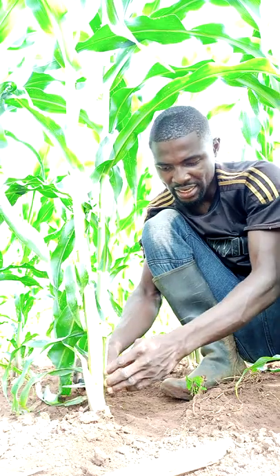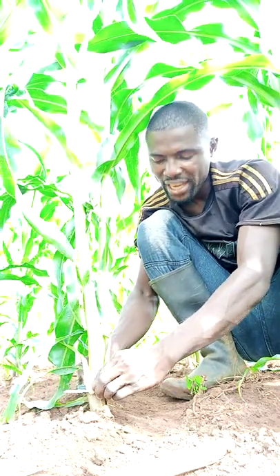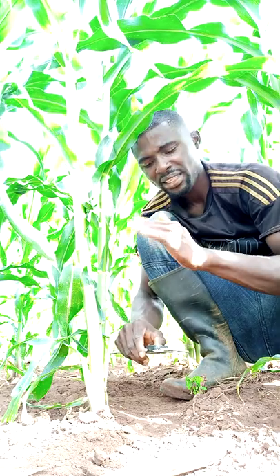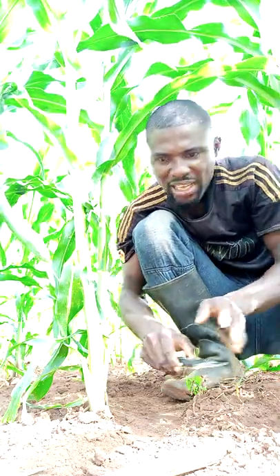Open it and hold, or use it to grip the base of the maize plant. In this case, the stem diameter of this maize plant is 2.54 centimeters. So that is the stem diameter of this maize plant.